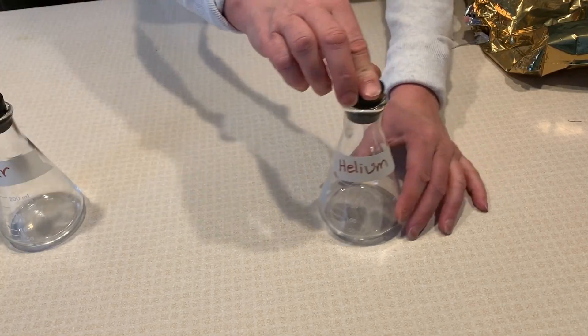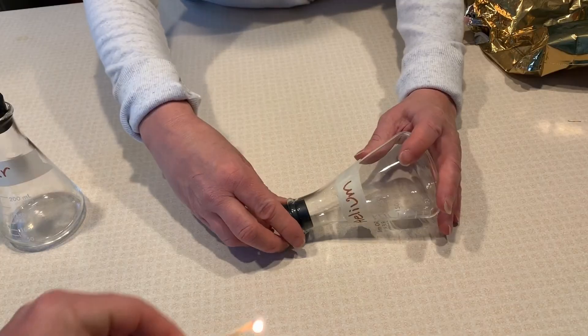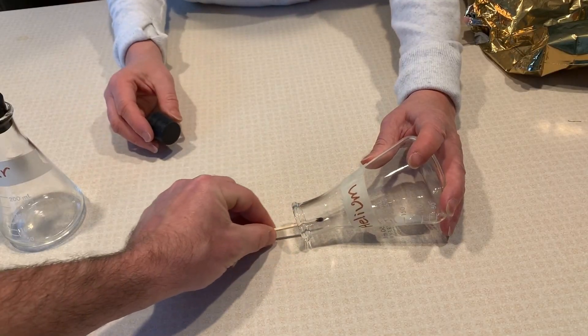And then we'll test the flammability of helium. Notice what happened.